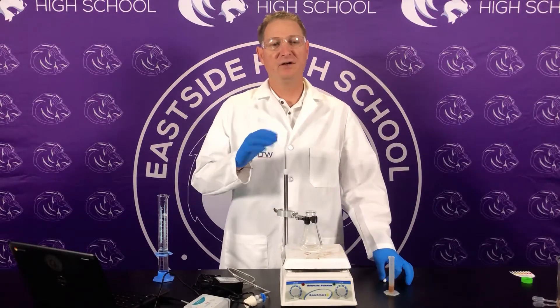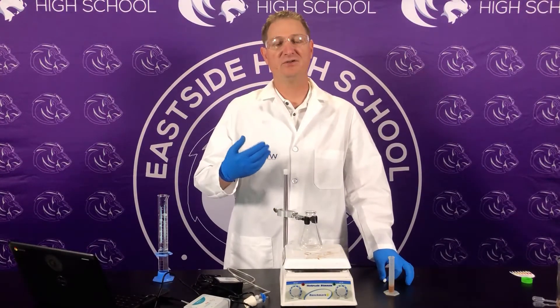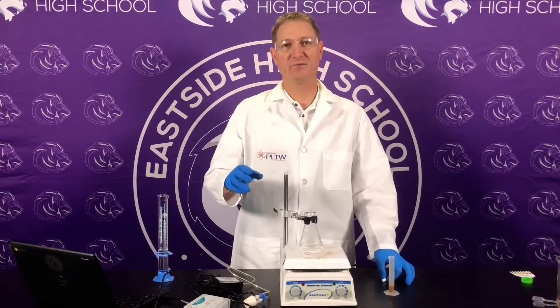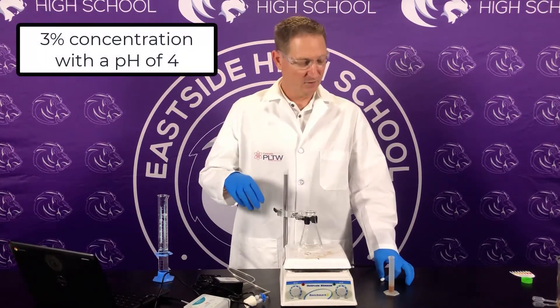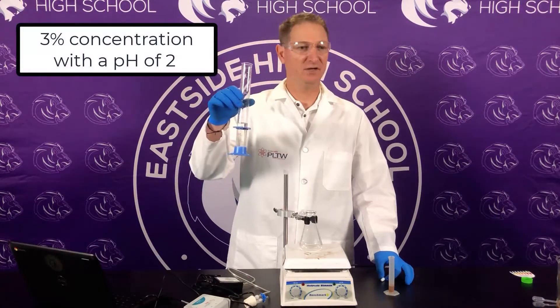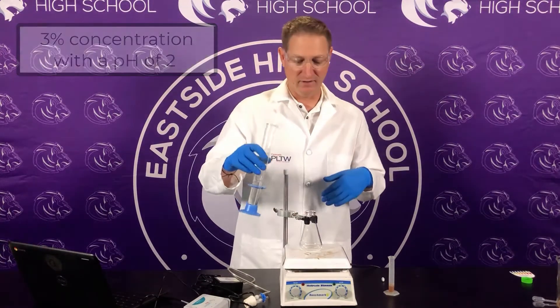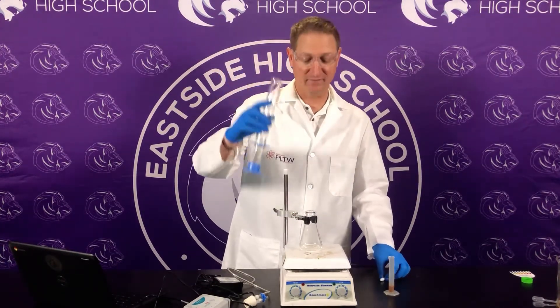If you're here, you chose pH as your variable. The original pH of the three percent H2O2 was 4. The pH we're going to use next is 2. I put some acetic acid in here to bring down the pH.